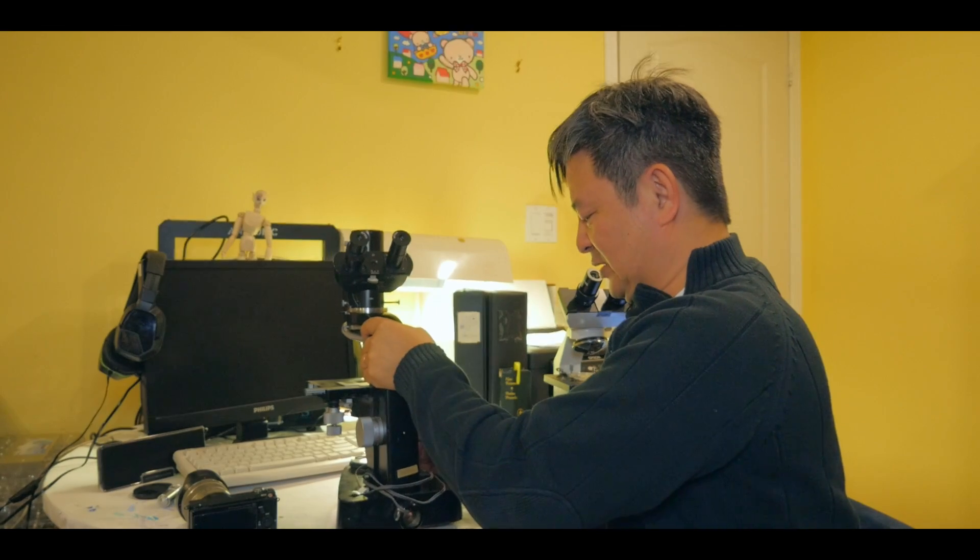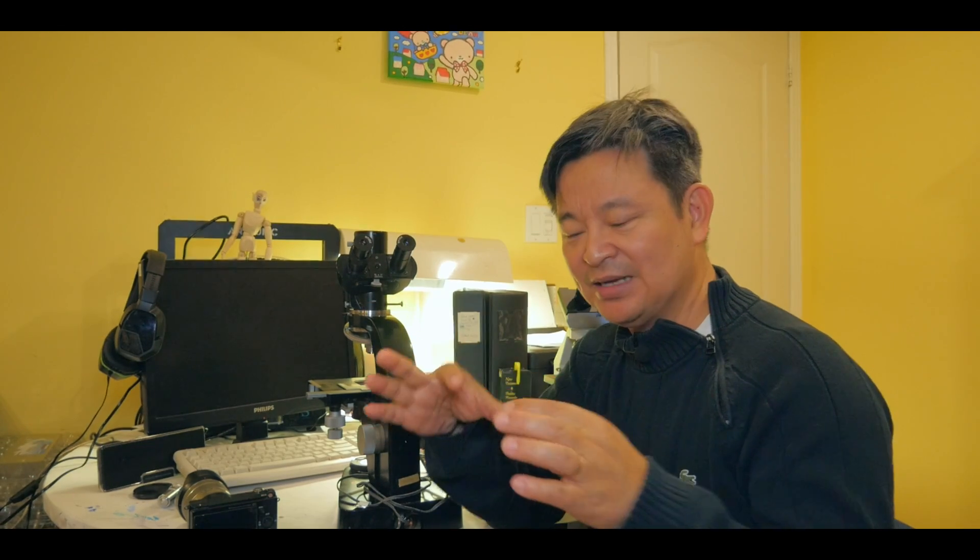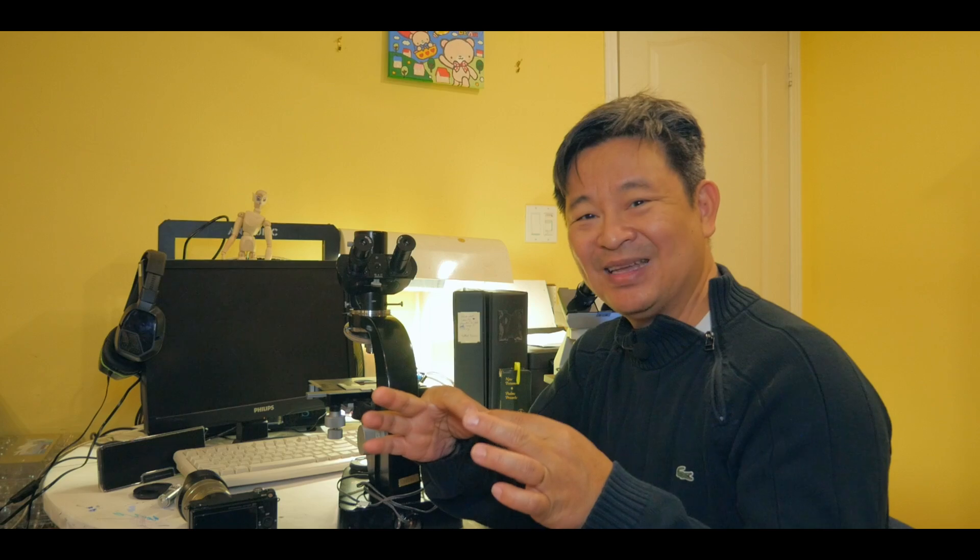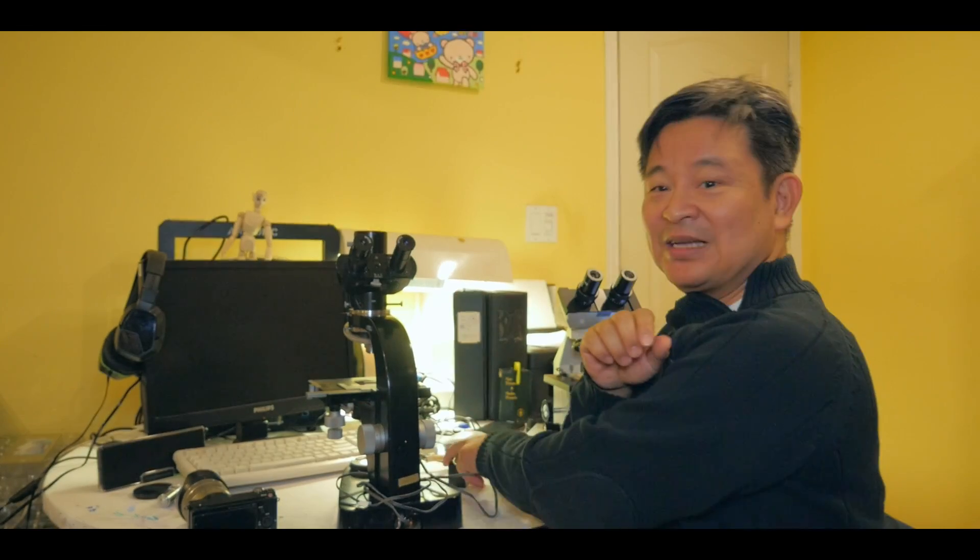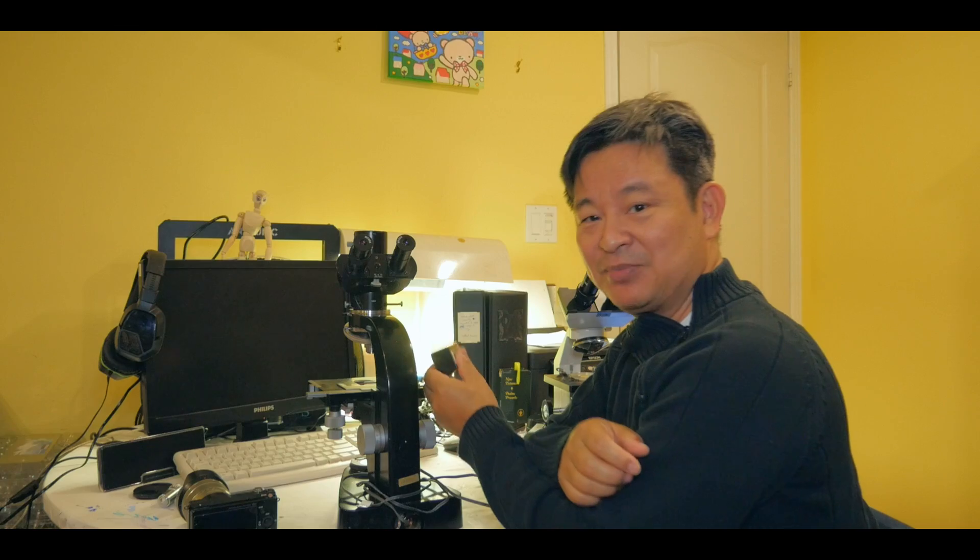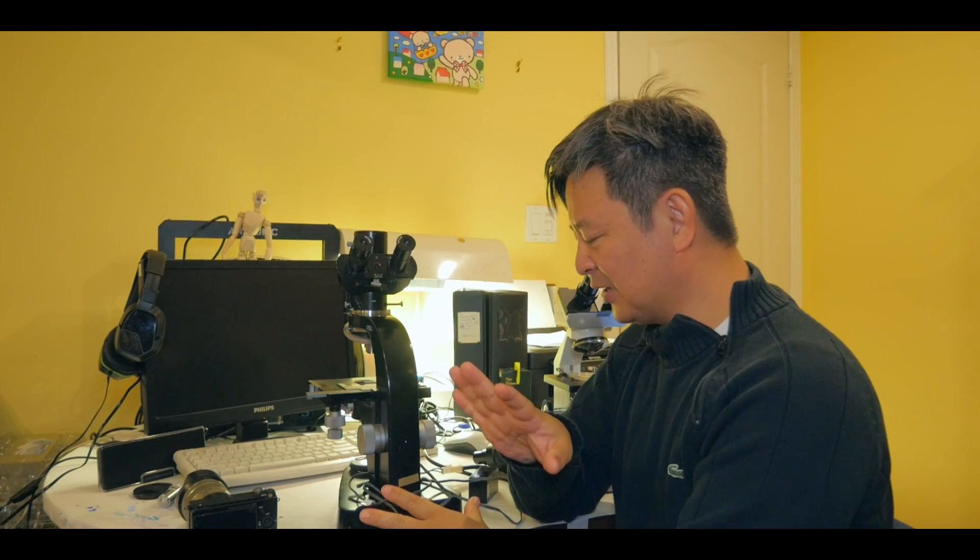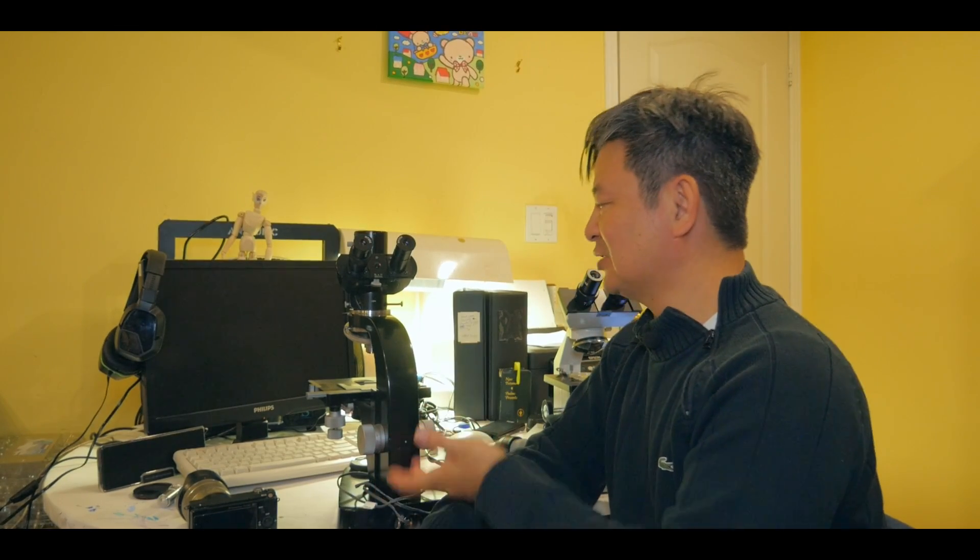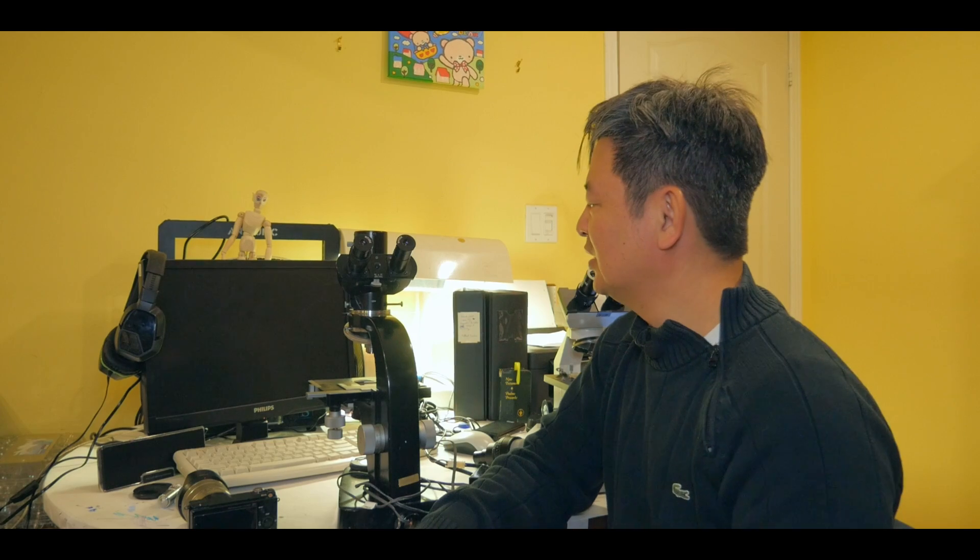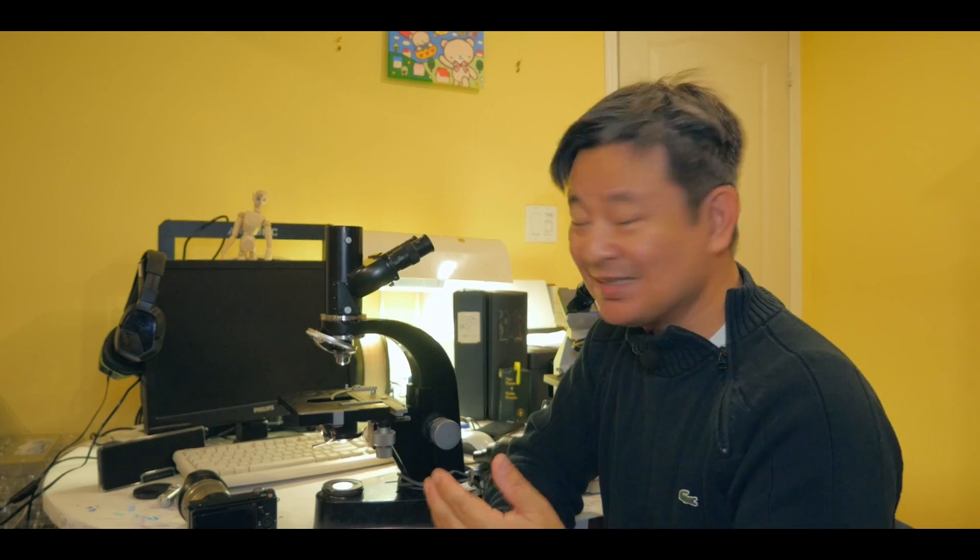So that was done. And so the reason I did that is because the halogen light bulb is very cheap to get now. I don't have to buy the specialized light bulb that comes with this microscope. And I don't know if they sell those anymore. In addition, the transformer, I mean, it's, yeah, I didn't like the fact that it's very bulky. So, you know, this tiny one is much better. So that's modified. The light source is now modified. So it's working. There's light that's going into the microscope, right?